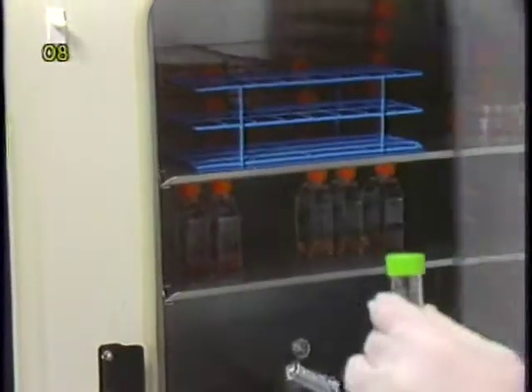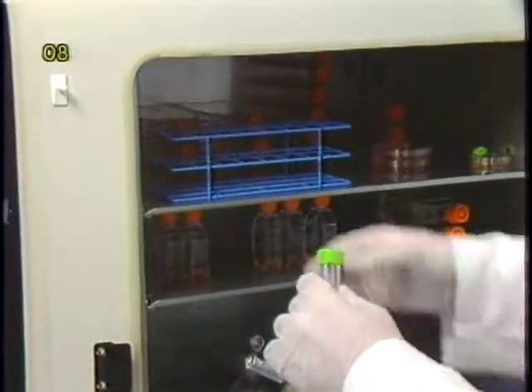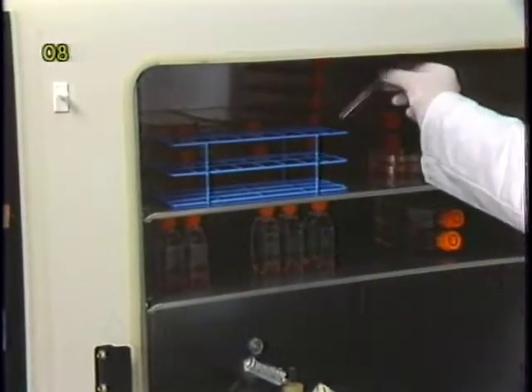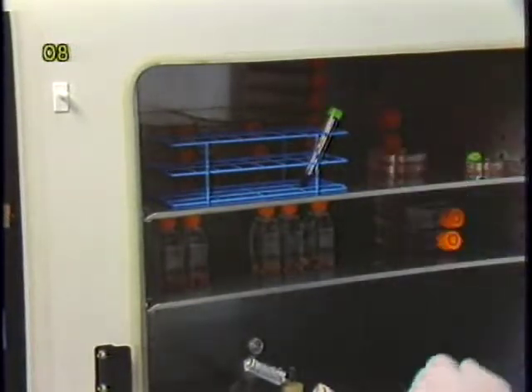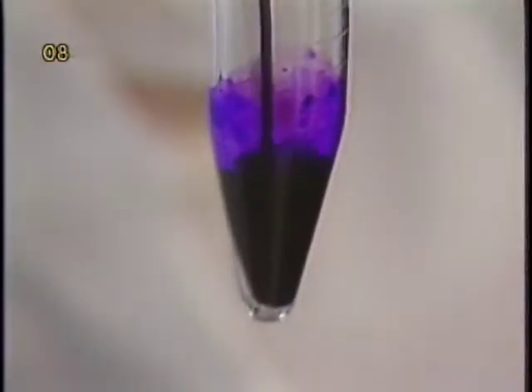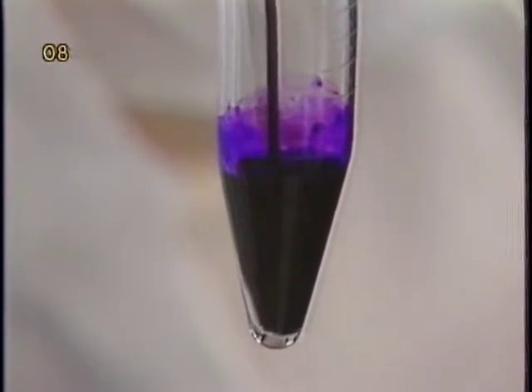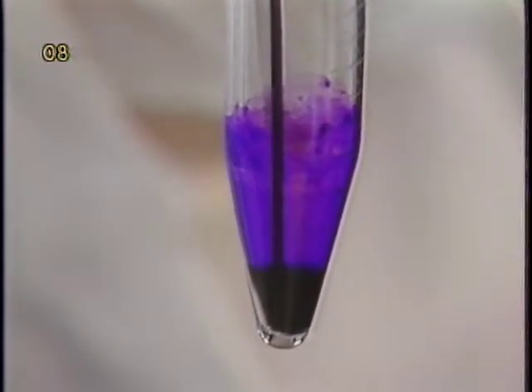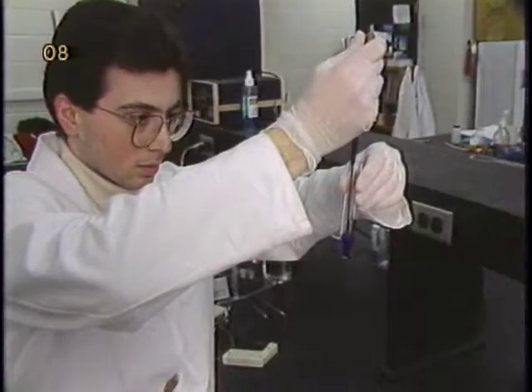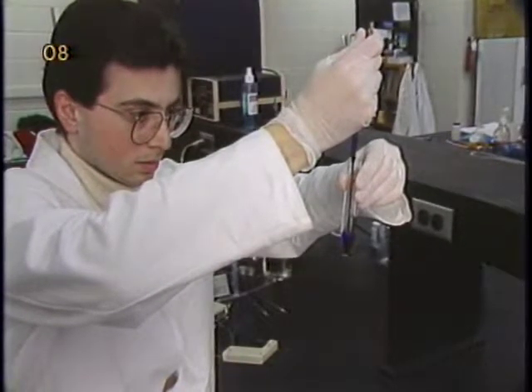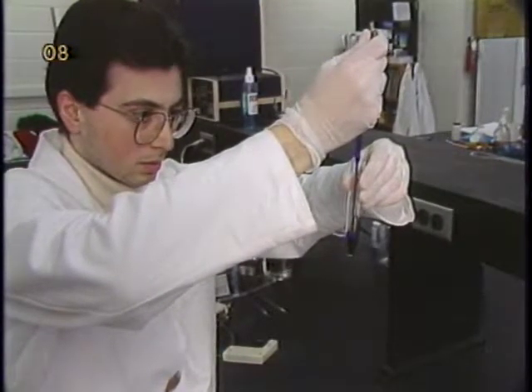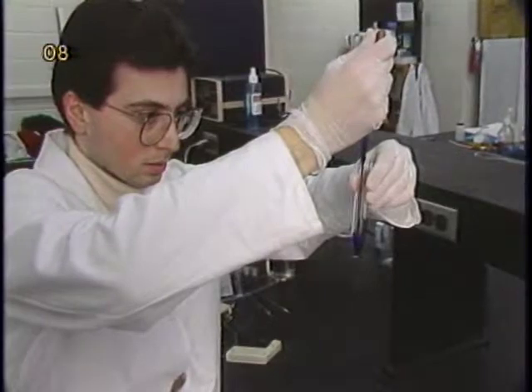This one hour incubation stains nuclei of the cells and also loosens nuclei from other parts of cellular material. These nuclei are then released from microcarriers by gentle shearing with a Pasteur pipette. A relatively gentle pipetting up and down through the Pasteur pipette is usually sufficient to release all nuclei.